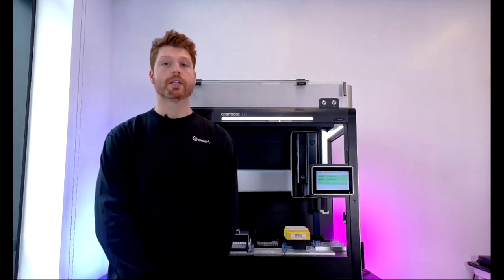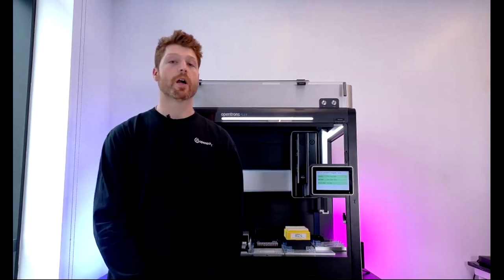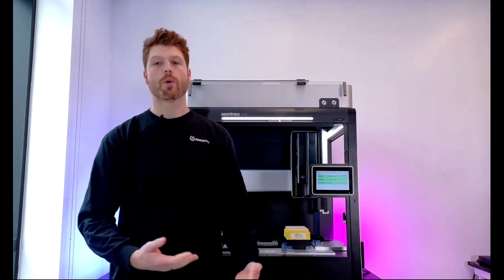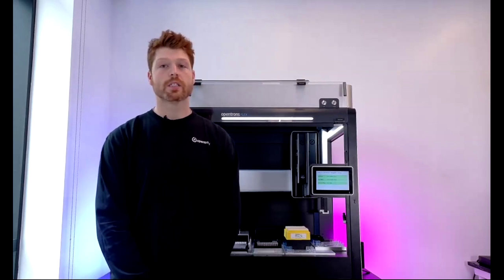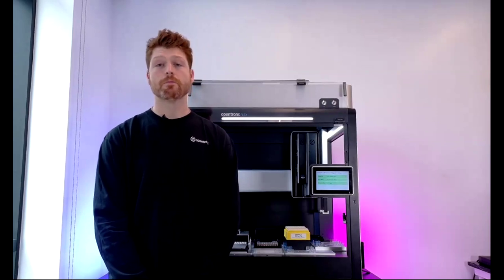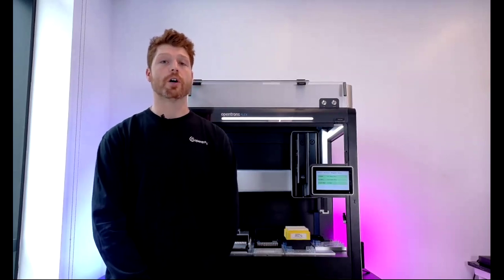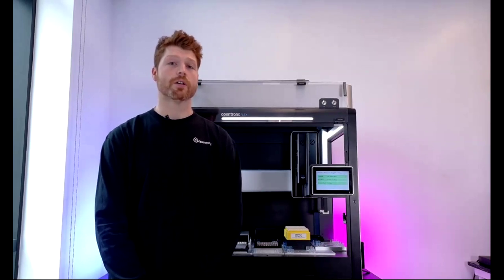And finally, the option that I'm going to talk about today is how to download a pre-existing protocol from our open access protocol library, which is a repository of pre-designed protocols, which cover a wide range of applications, from DNA extractions to PCR setups. And I'm going to walk you through the process of finding and then downloading and then finally uploading a protocol, which is going to fit your needs and hopefully fit the workflows.